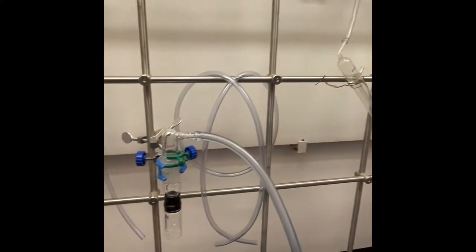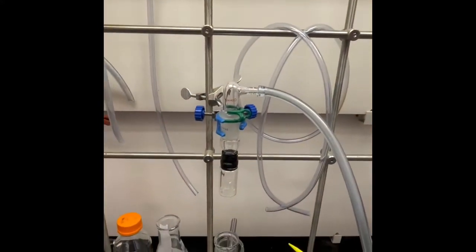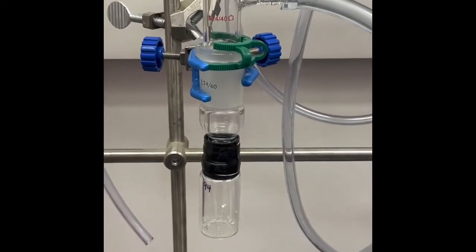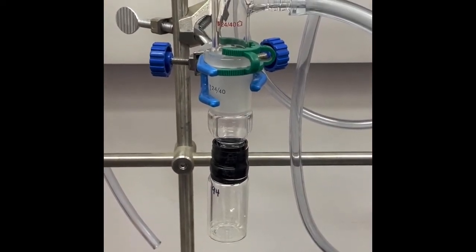Finally, the product is hooked up to a vacuum line to remove any residual solvent. You can see the product in this vial here, appearing as a small amount of a white solid.